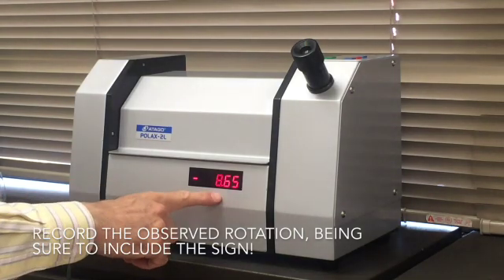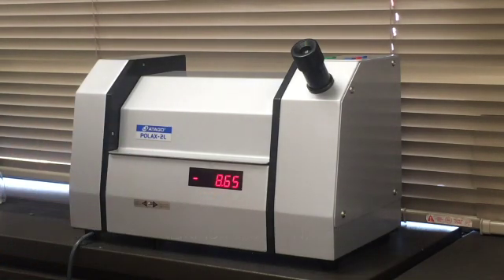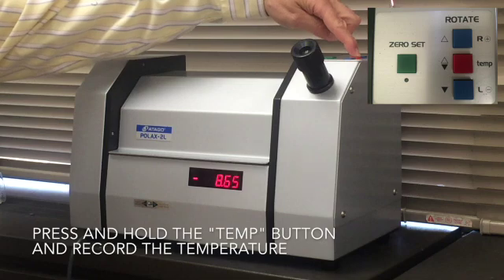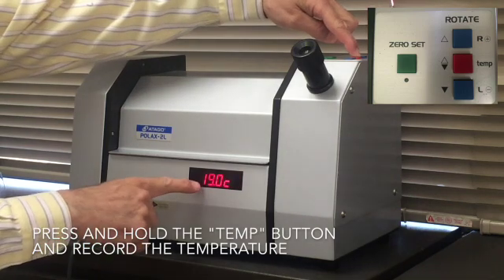Now I write down that number and I want to press the temperature button and read that temperature.